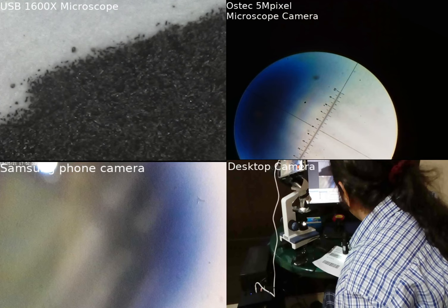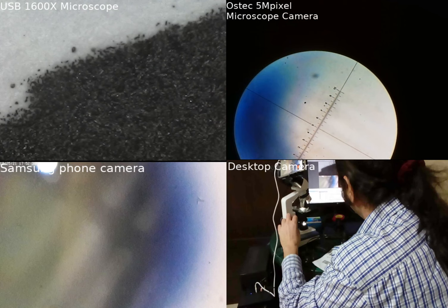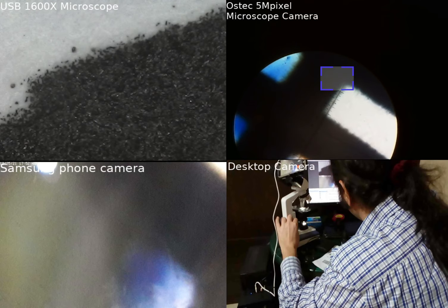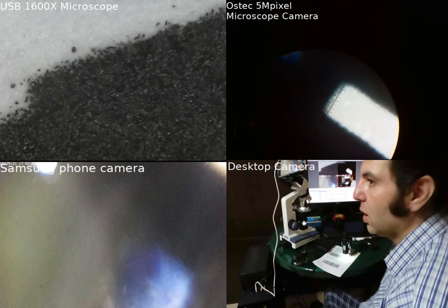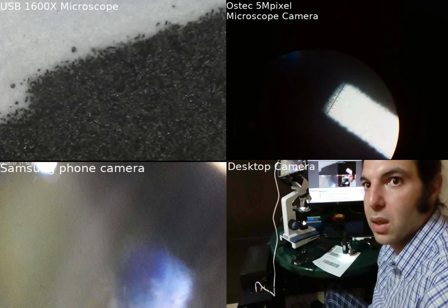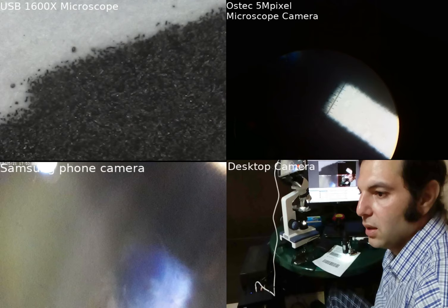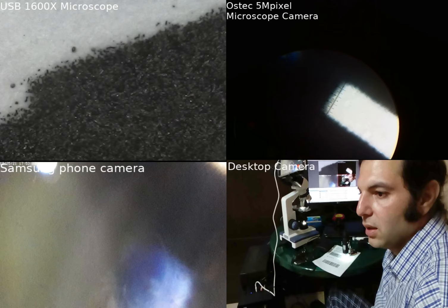You can see the graduation marks of the ruler inside the lens. At 1000 times magnification you can see some detail. This is all about showing the differences when using each microscope. You can deduce the difference yourself — this is 1000 times magnification on the biological microscope.